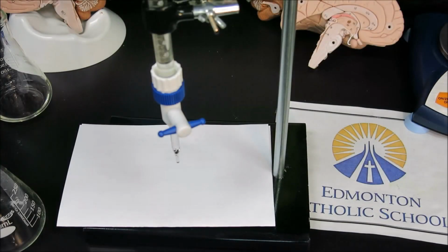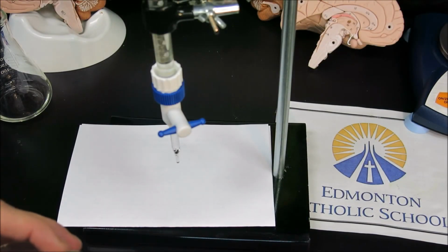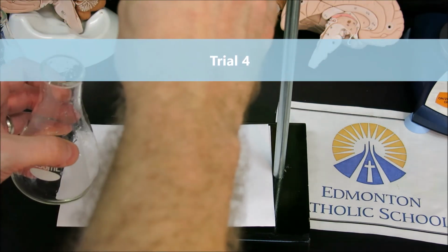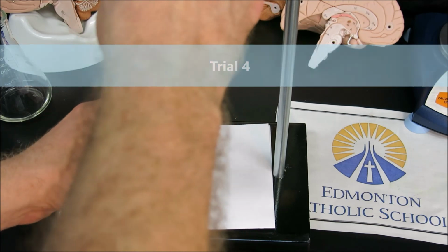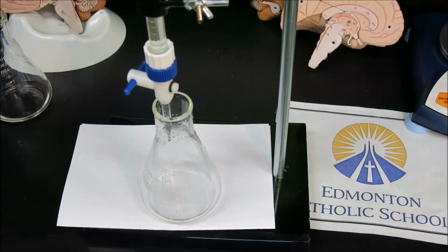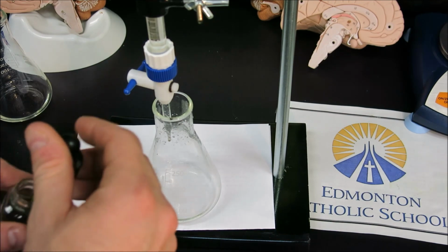One of the important aspects of titrating is, of course, measuring your sample with great precision so that there is no chance that the volumes added are actually dependent on this volume of the sample.